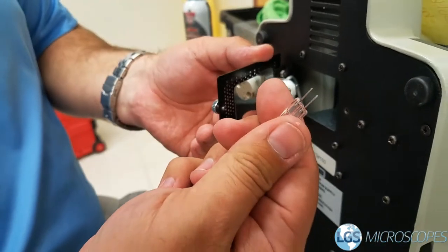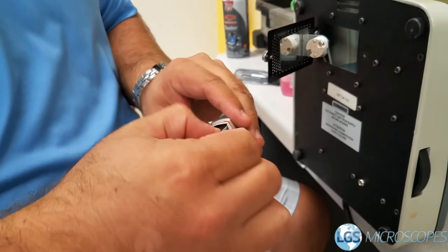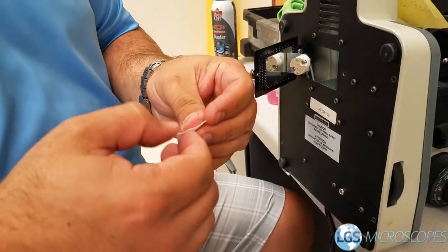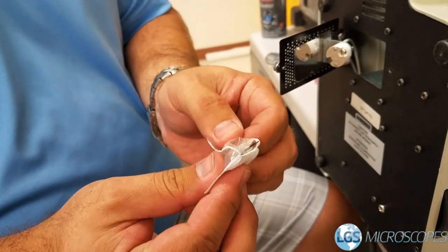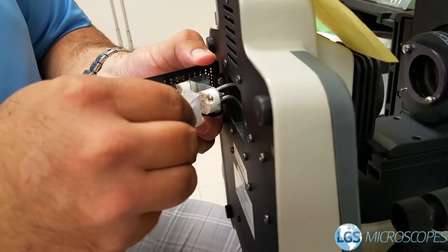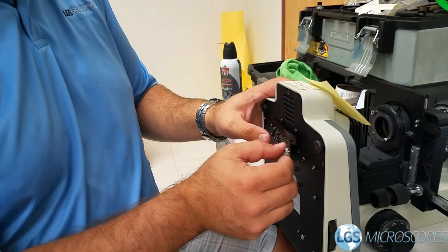Make sure it's not hot — obviously it's not because it's dead. I'm going to take our new bulb. The important thing is to not touch the bulb, because the oils from your fingers can decrease the life of the bulb. So we're going to open it and just grab it by the packaging. Stick it in there. If you do touch the bulb, just clean it off with some alcohol.